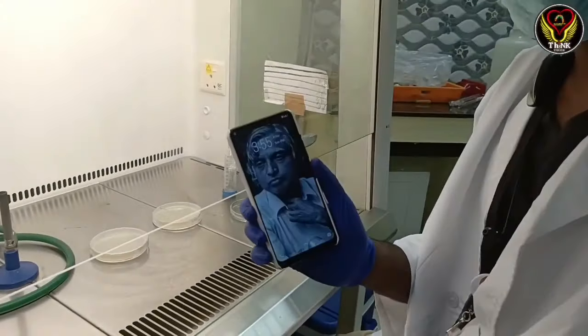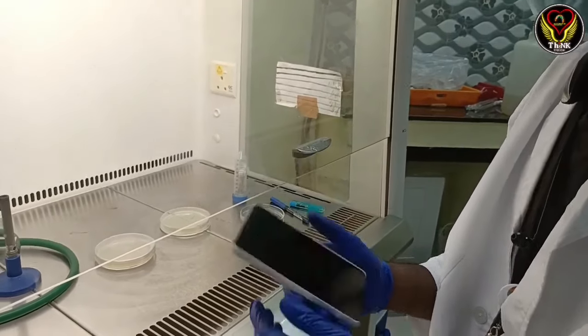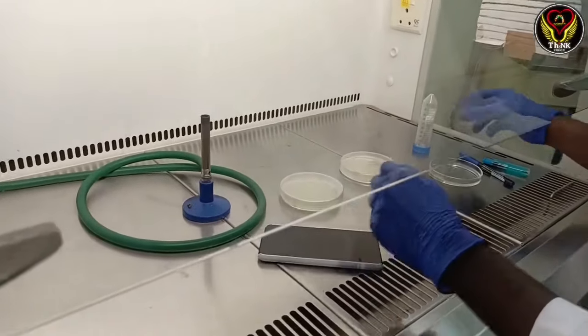We're going to take the sample to the plate. We're going to take a sample and put it on the plate.